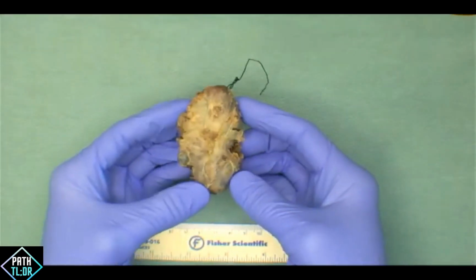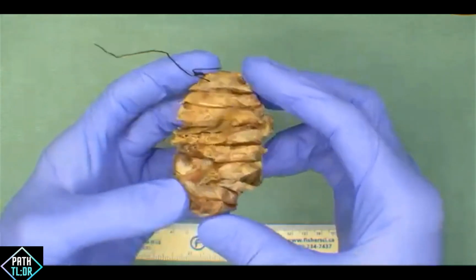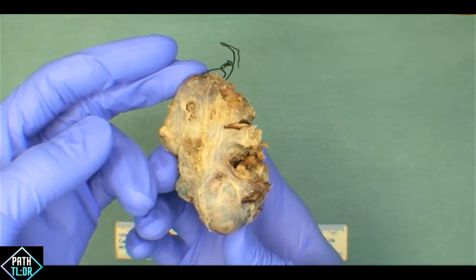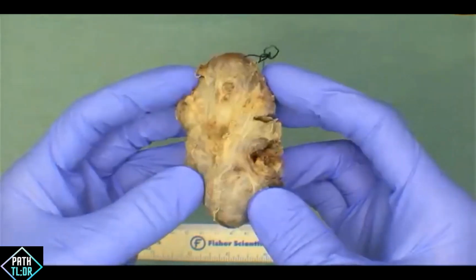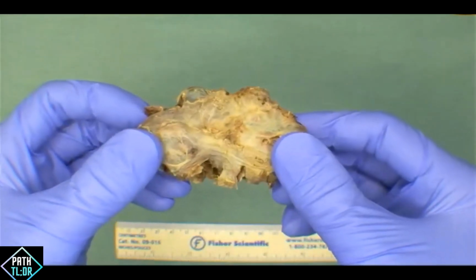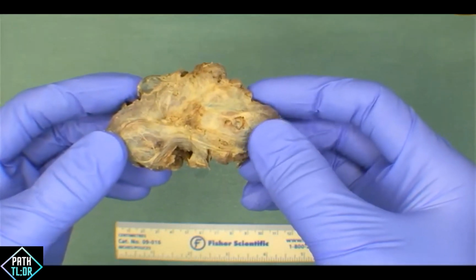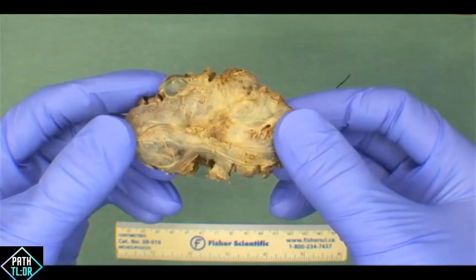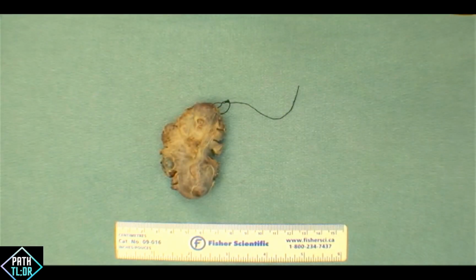So for this to be a bladder, this would be unusual because it would be so small. But we can tell that this is a solid organ as opposed to something that has a lumen. So we can exclude the bladder. And then going to a soft tissue resection based on what we can see on the screen, this could easily qualify as a soft tissue resection. But perhaps what are some of the features we might be missing to exclude this from being a soft tissue resection? Yeah, okay, so sometimes we can get some skin on it. Generally speaking, we'd probably see some muscle, plus or minus some fat, and then plus or minus some fascia as well.